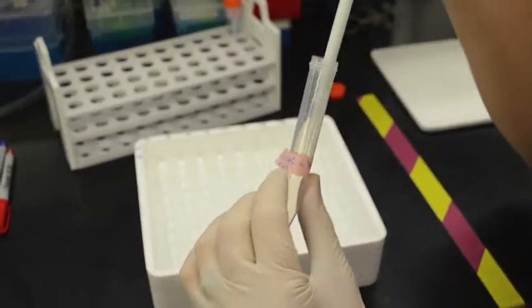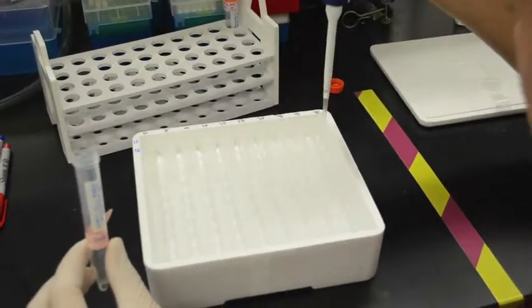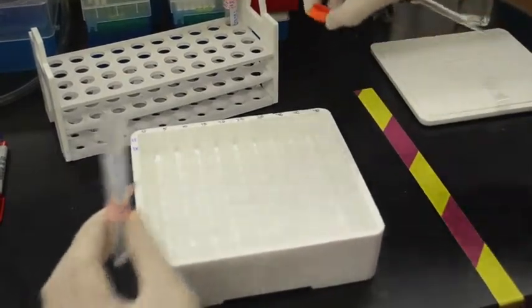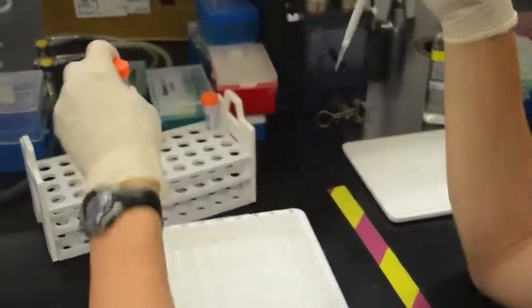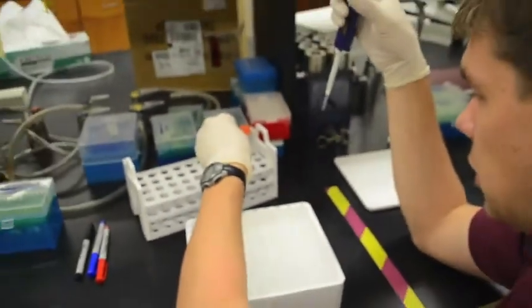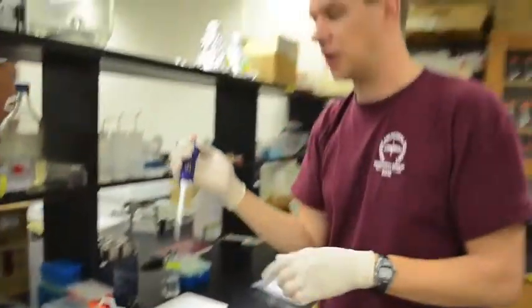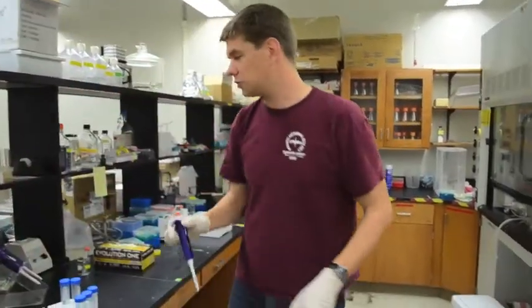And for these kinetics measurements, we want to get a few concentrations on either side of what's called the Km, so the sort of value at which it starts to be saturating. And usually for peptidases, that's around maybe 100 or 200 micromoles per liter. So that's why I've chosen this concentration.